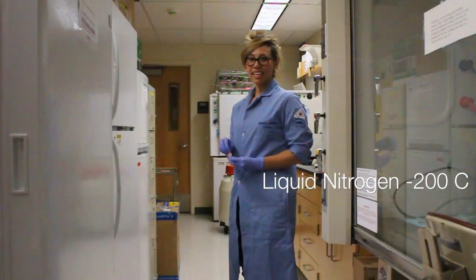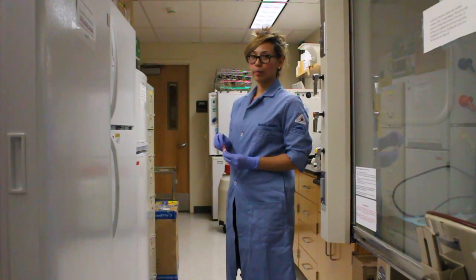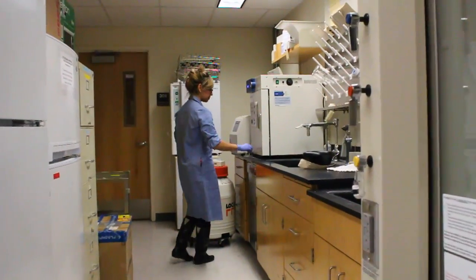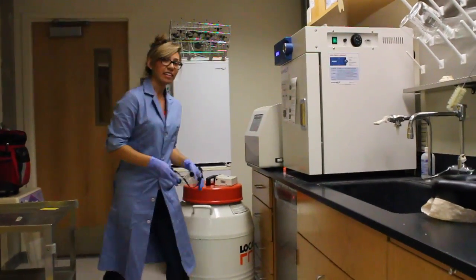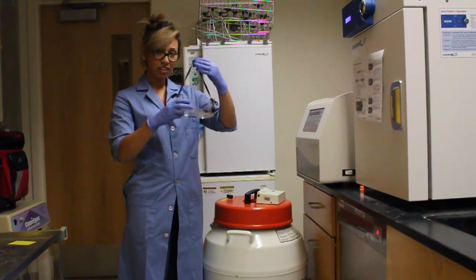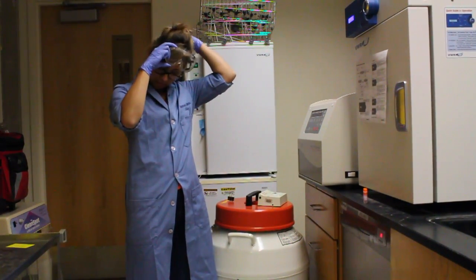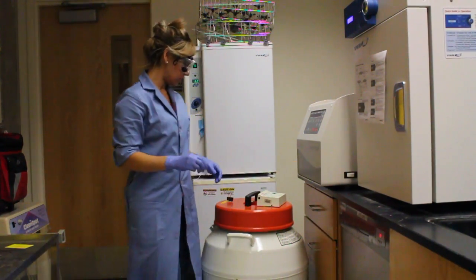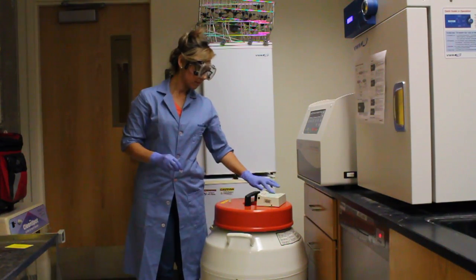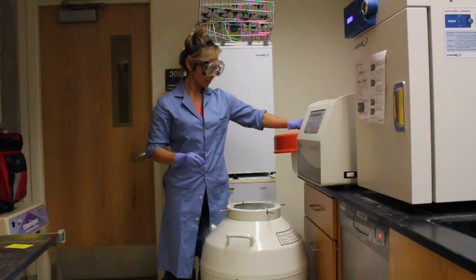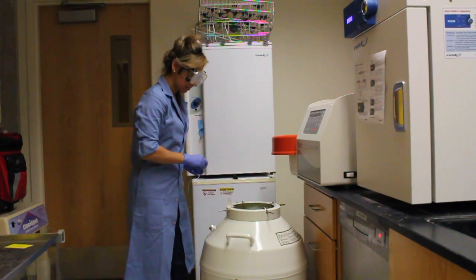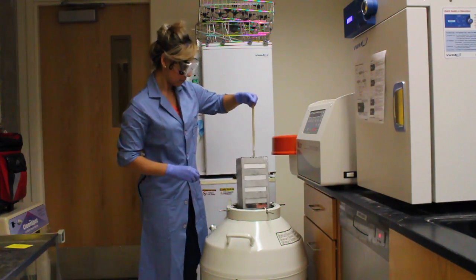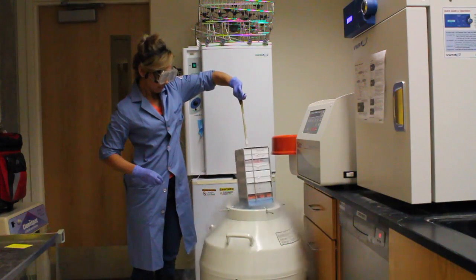Then you're ready for the liquid nitrogen. Welcome to the instrument room, we're going to freeze some cells. This is where we keep our nitrogen tank. Using goggles or safety glasses and gloves, we can access the nitrogen tank. Remove the pin and lift the lid up to open the nitrogen tank.